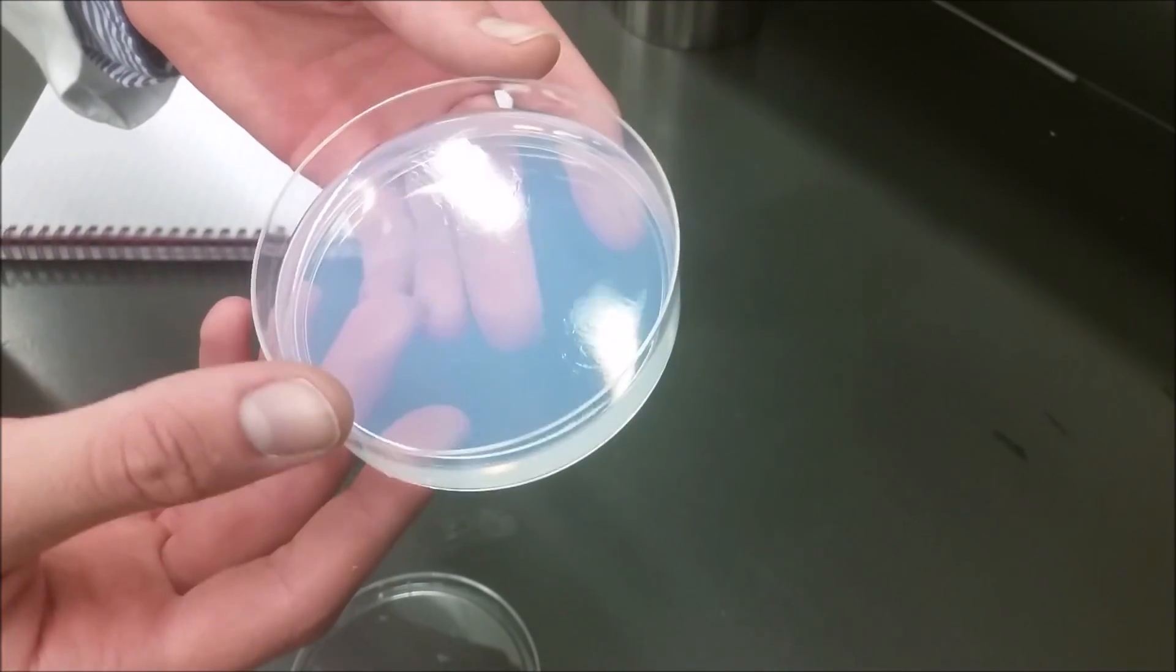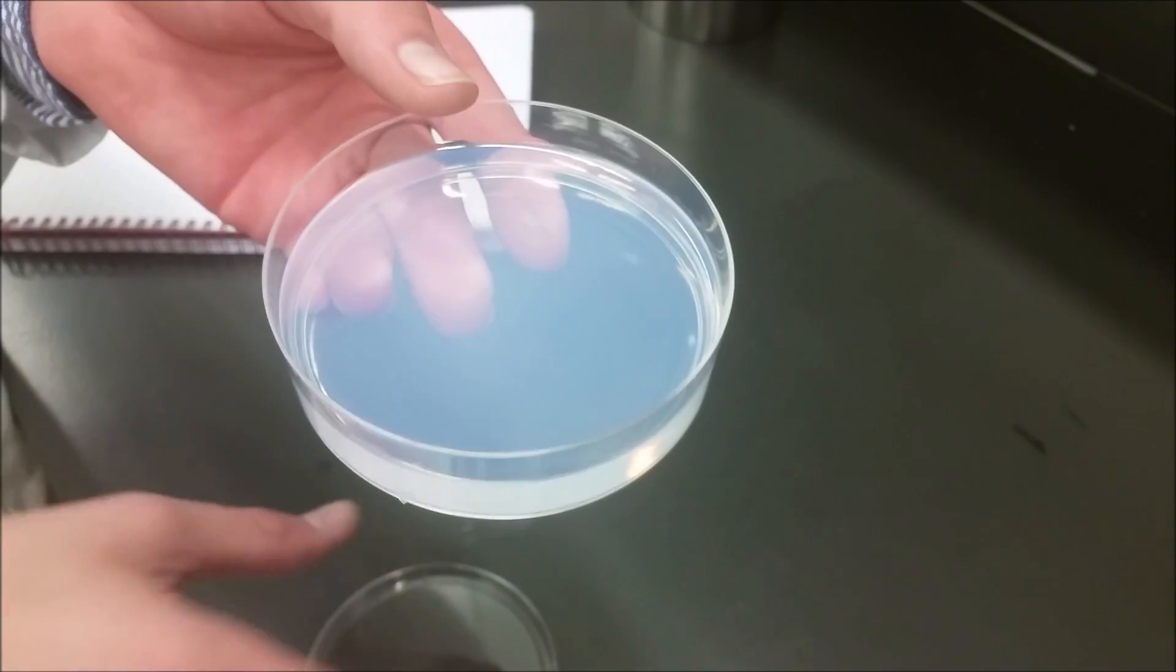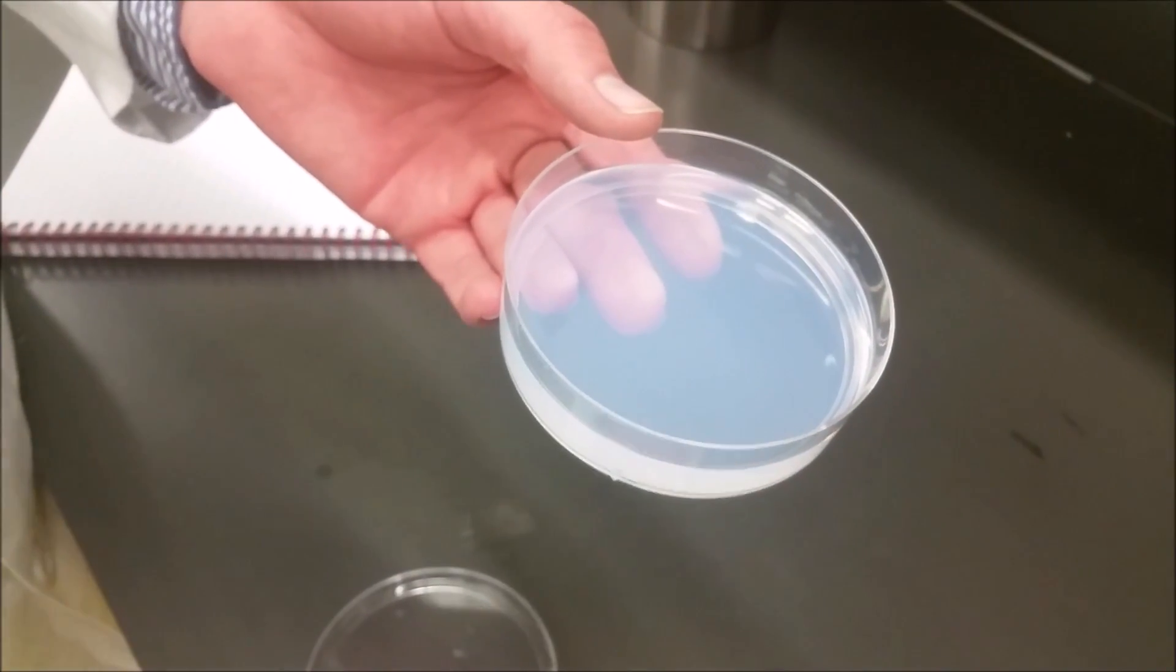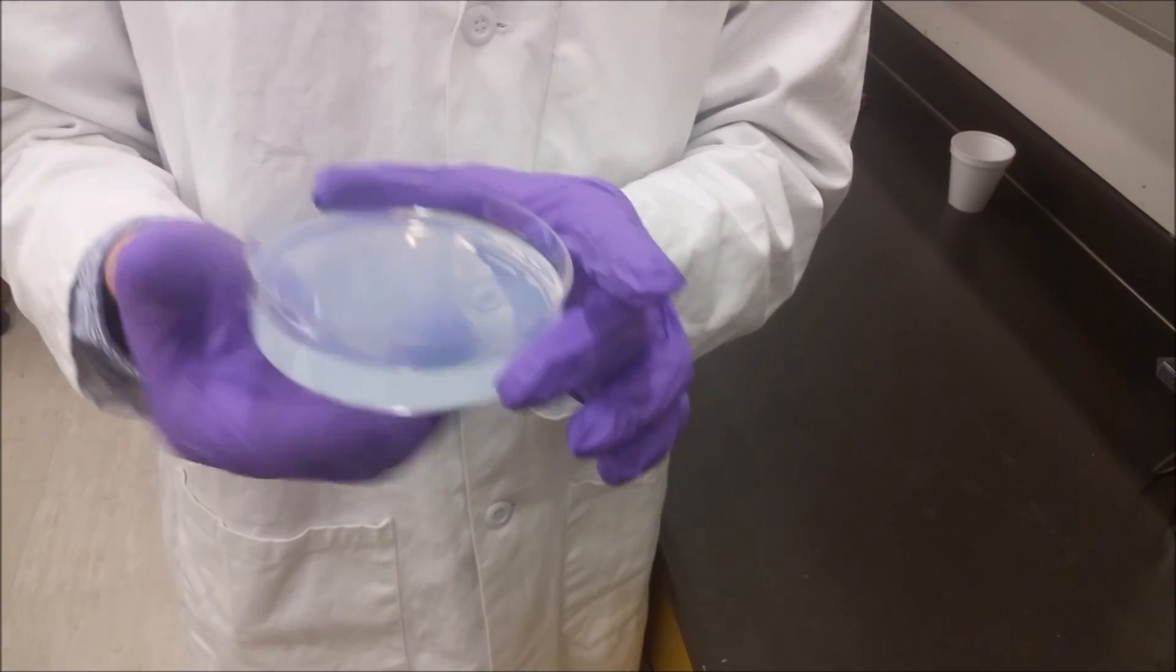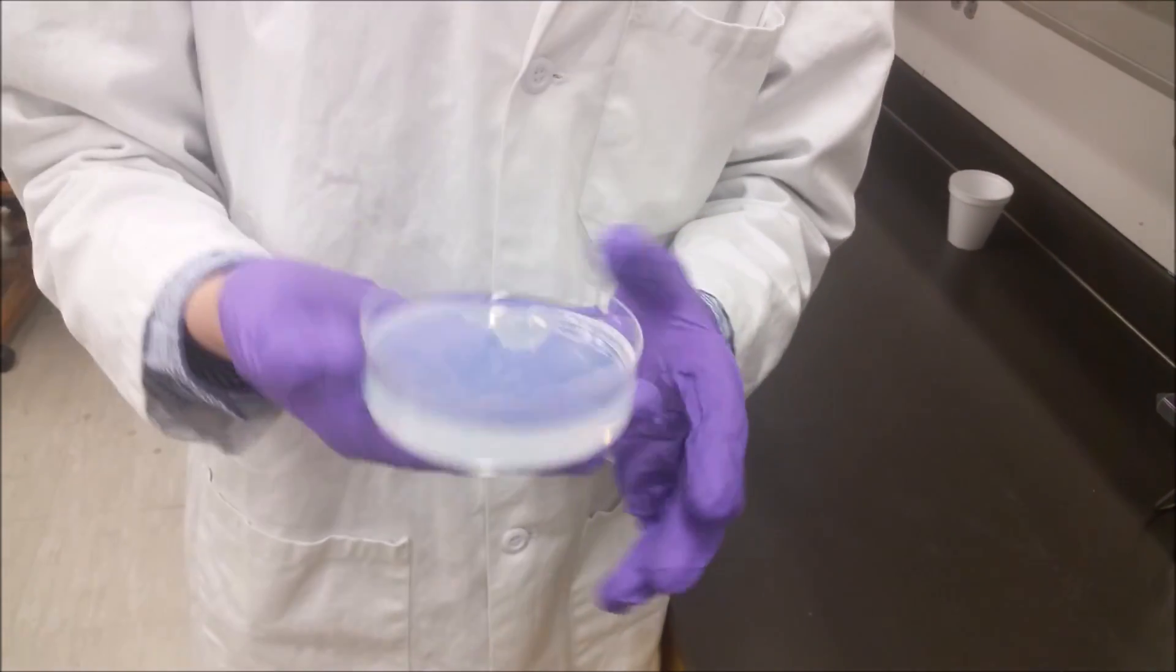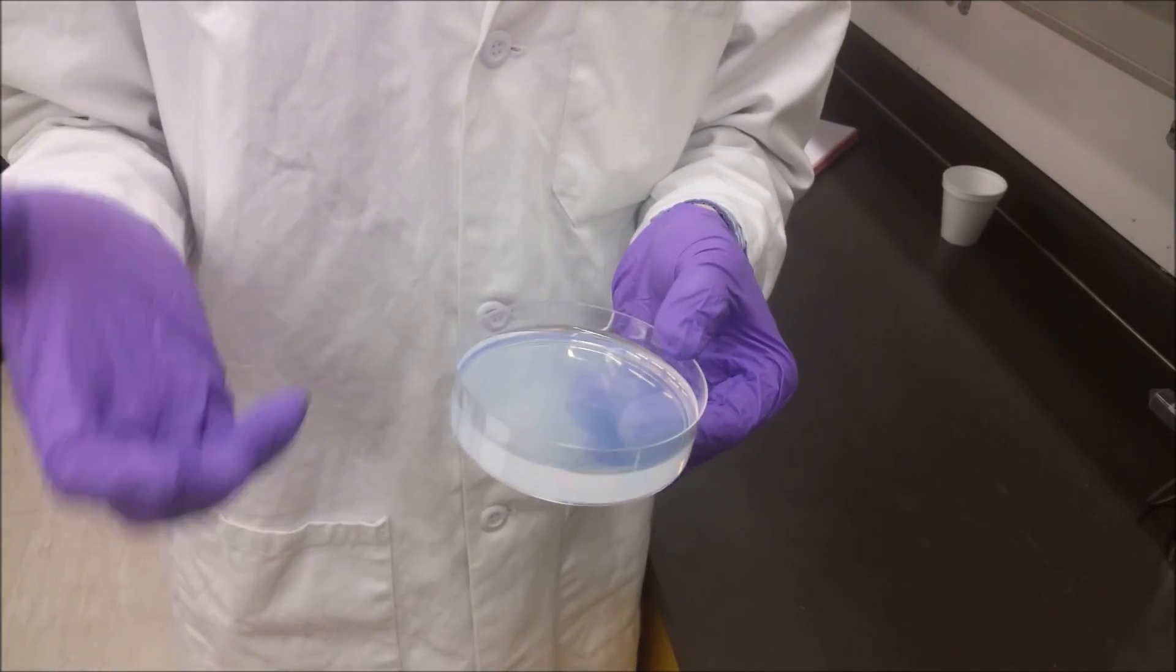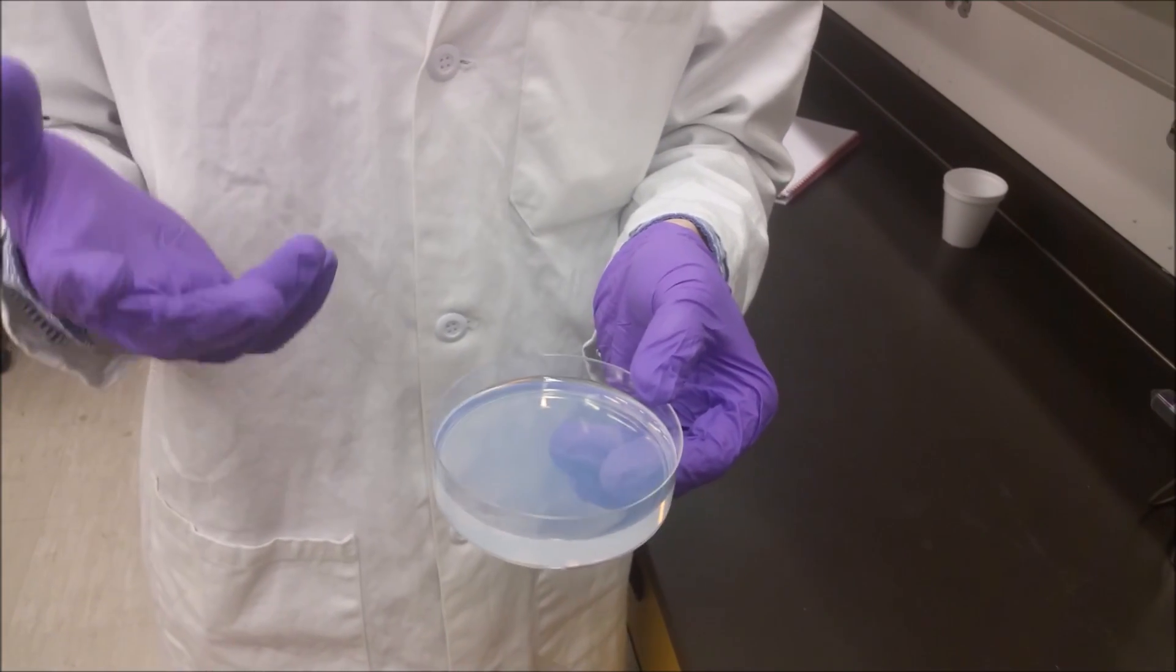So this could now be turned into an aerogel if I processed it correctly, just like these. What is very interesting about this particular gel is that even though it is in fact a gel, it doesn't come out of its container.